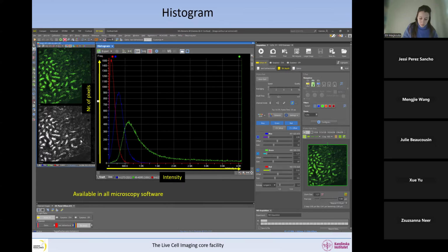And what we can read from here in this image that has 3 colors, so this is a 12-bit image, so we have up to 4095. And when we look at the pixels that are at 0, what we can see is both the blue image and the red image have a lot of pixels of the intensity 0, whereas the green image does not have any underexposure. So these are underexposed pixels. That's not good. We want to avoid this. And then we will look on the other side.